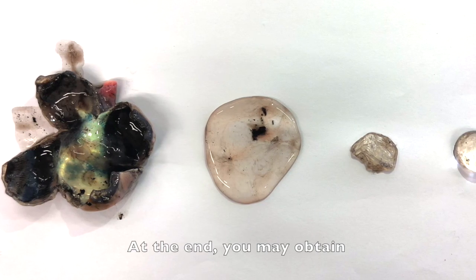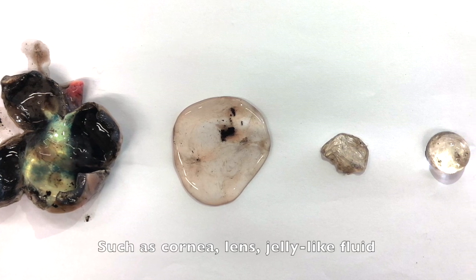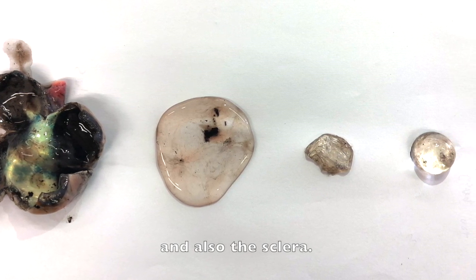After the experiment, you may obtain these four structures from the eye. The first one is the cornea, and then we have the lens and the jelly-like fluid, and also the sclera.